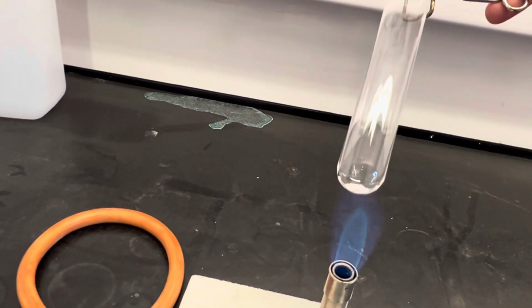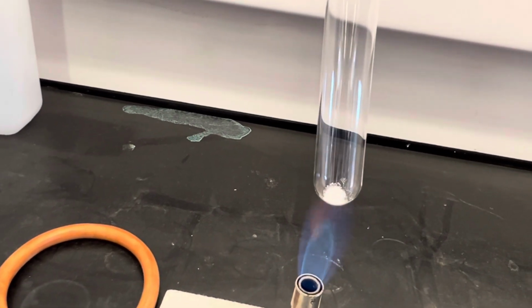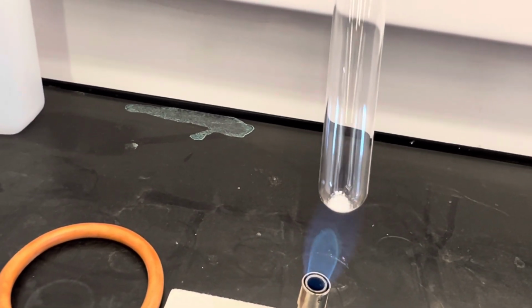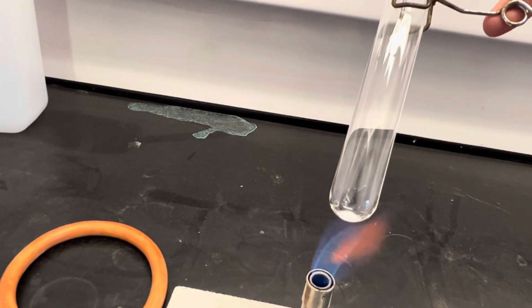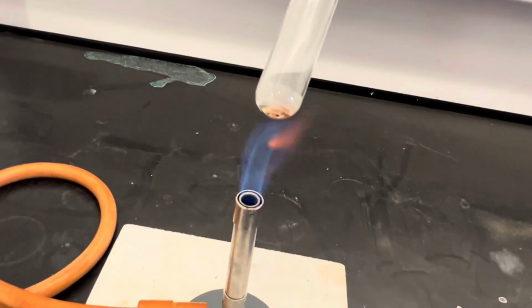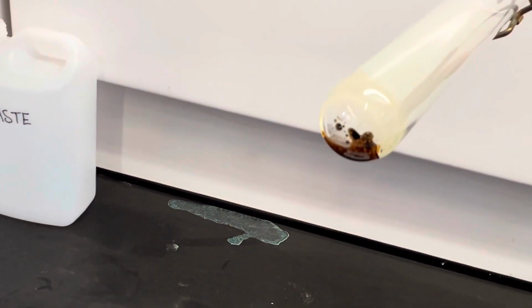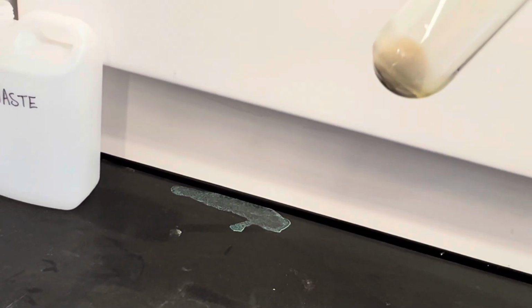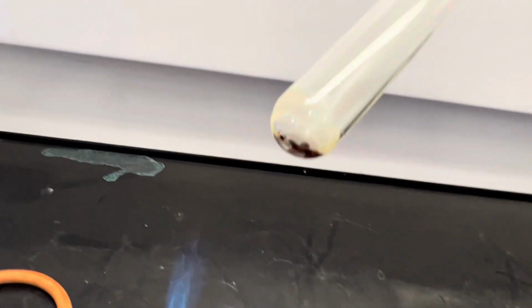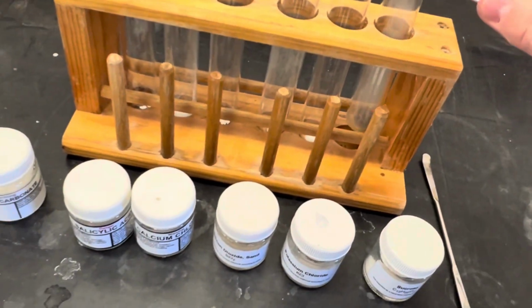We'll use that one for about 5 seconds. See, something looks like it's changing a bit. I can see some fumes coming off. Yep. Look at that. It's a brown, sticky liquid. So very indicative there. That's what most sugars will do, most carbohydrates. So yeah, sucrose. You can see those fumes in there as well. Sucrose definitely has a lower melting point.